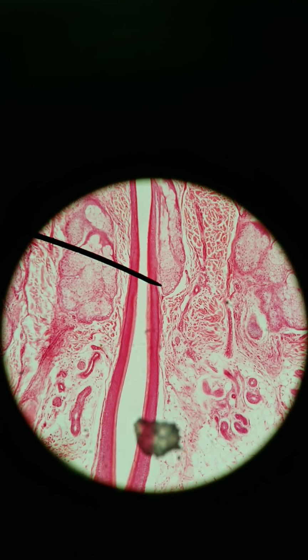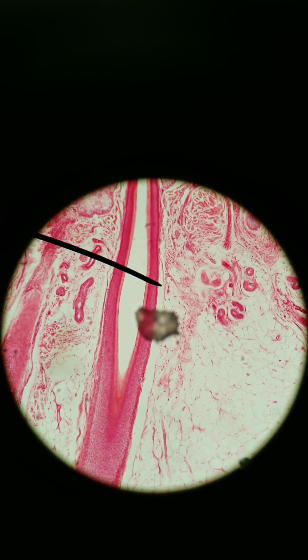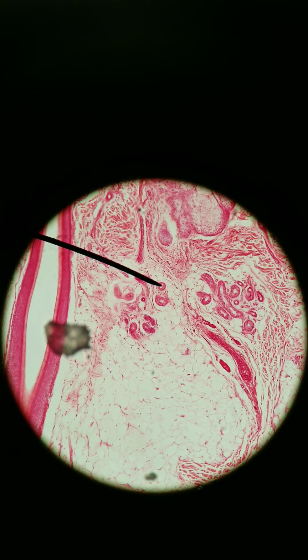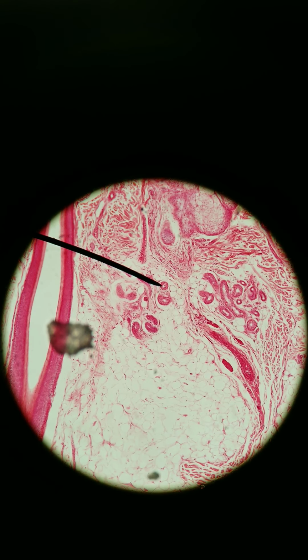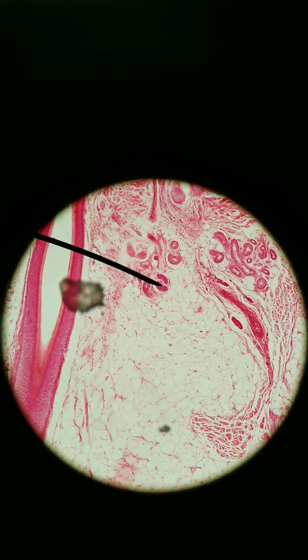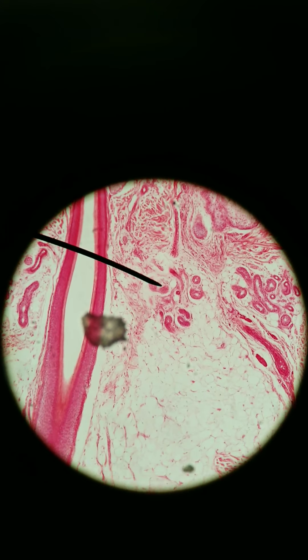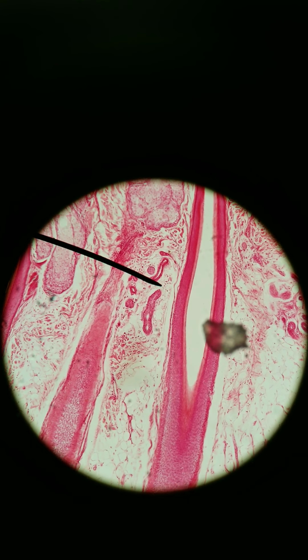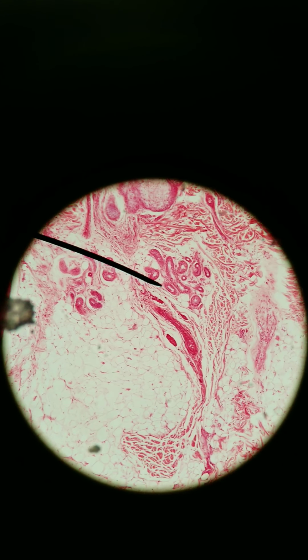One other gland that we want to find, which is actually right here, ignore this thing in the middle, that's just debris. It's on either side. These glands here and these glands all over here. We can see clusters of circles that are dark. So we know it's epithelium, but it's epithelium that's really deep. It's in the reticular and hypodermis layers. These glands have relatively small collapsed lumens, and they're clustered all together.